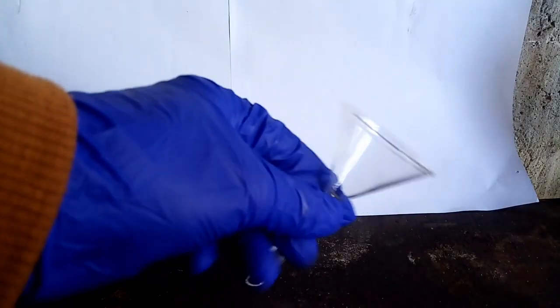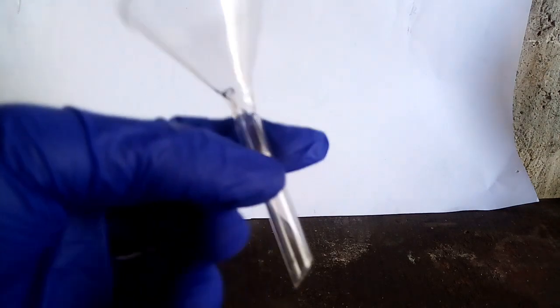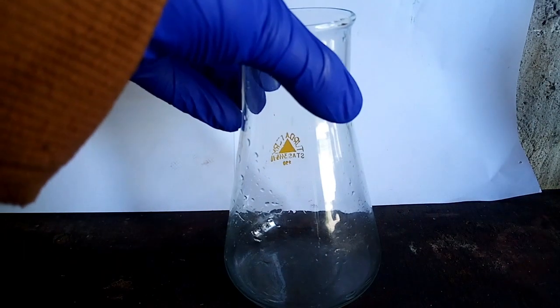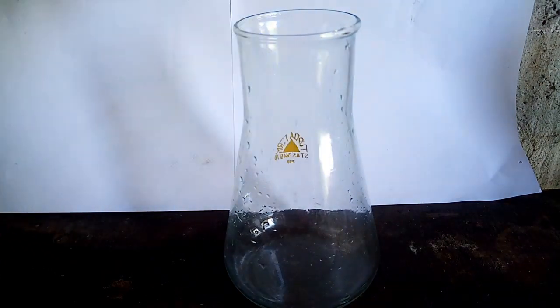To do that I will use just a funnel with cotton in it. So I take an Erlenmeyer flask and put the funnel with the cotton on it.